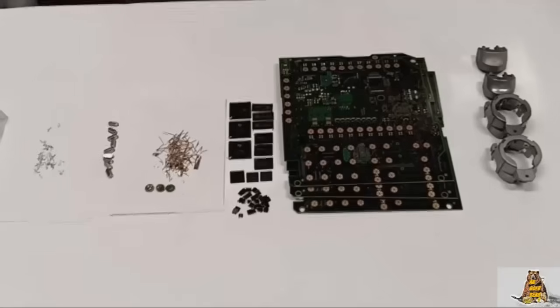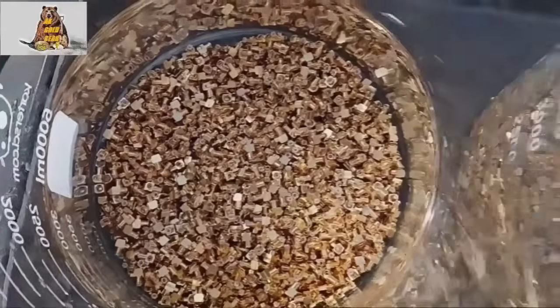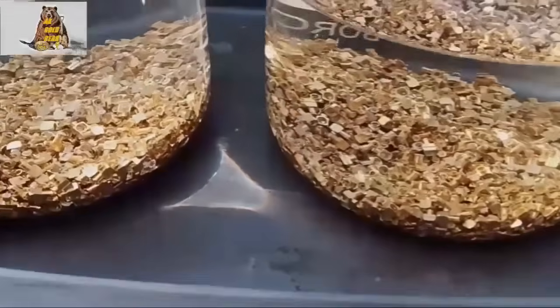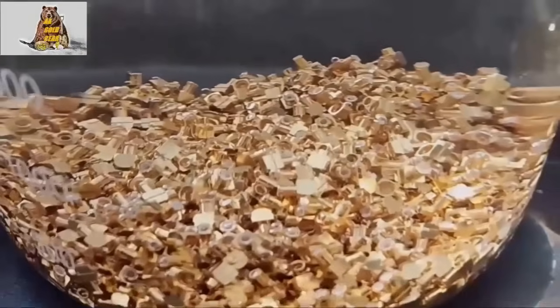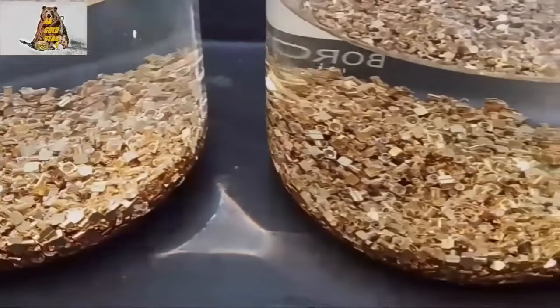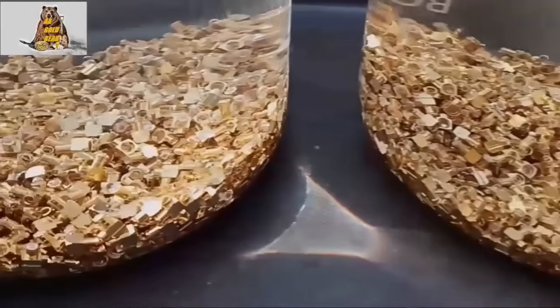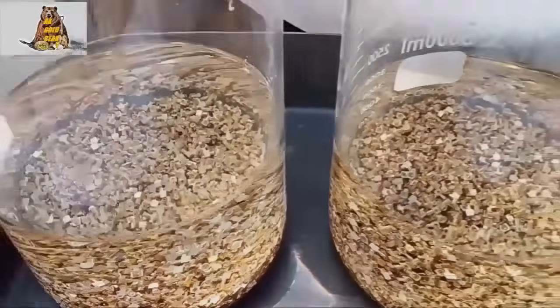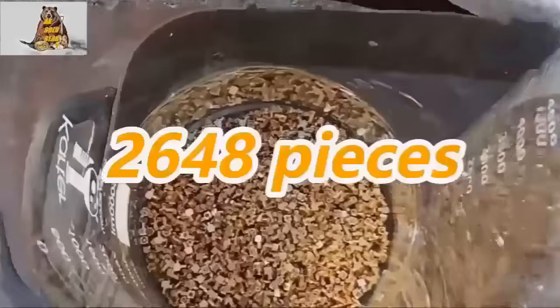A little bit of gold and silver from my work. Hello YouTubers, and hello to those who are interested in gold prospecting in creeks, in gold mines, or at home with acids. I am AK. Welcome to my little channel. The goal of my video today is to get copper sulfate from the solution after dissolving gold plated connectors. I need copper sulfate. Here I have exactly 2648 connectors.